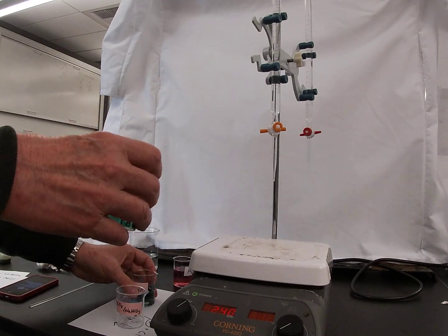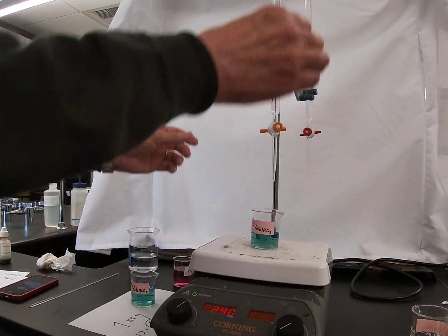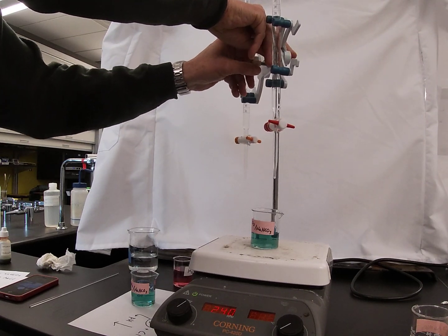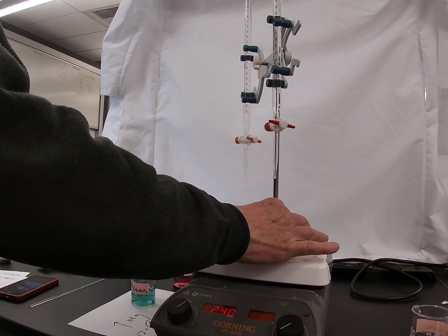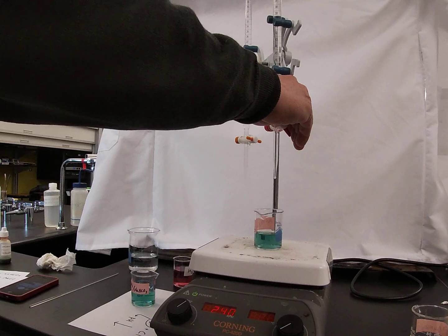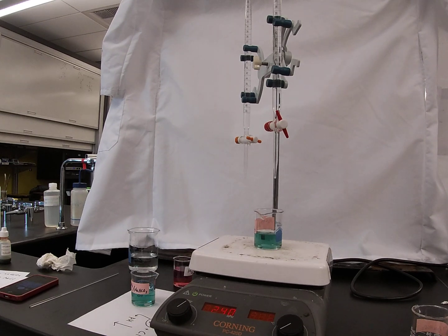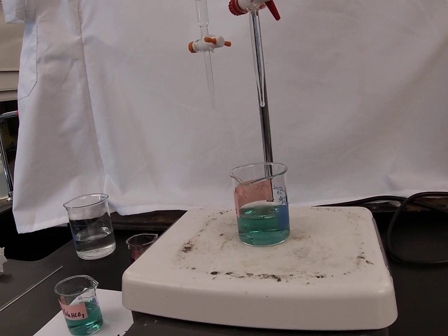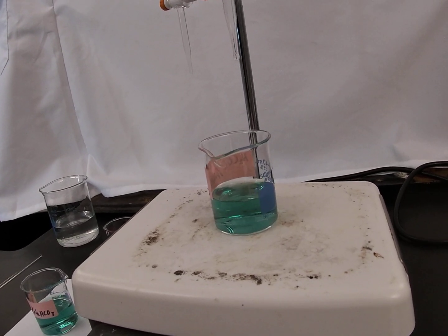I'm then going to spread it out into our two test beakers, and we're going to repeat the experiment, starting as we did with hydrochloric acid and continuing with the sodium hydroxide. I'll turn that so you can see a little better. You can see the little stir bar stirring things up, and once again I'll start the burette, slowly dripping hydrochloric acid in there. 1 drop, 2 drops, 3 drops, and so on up to 11 drops.